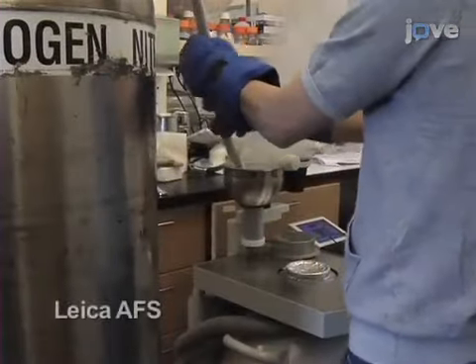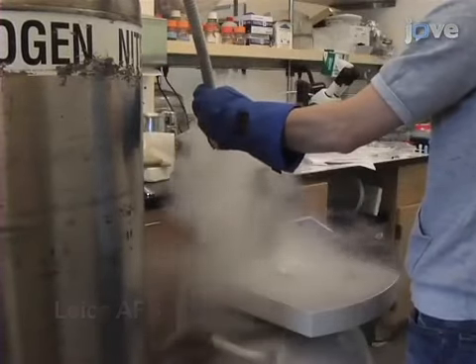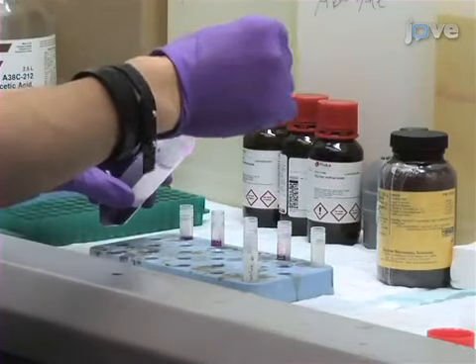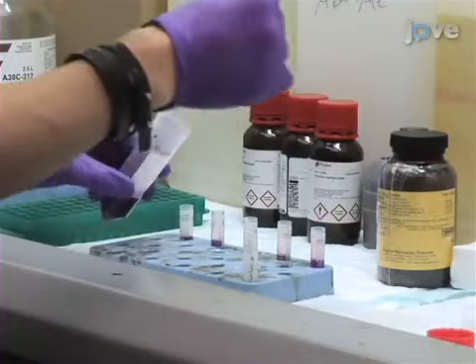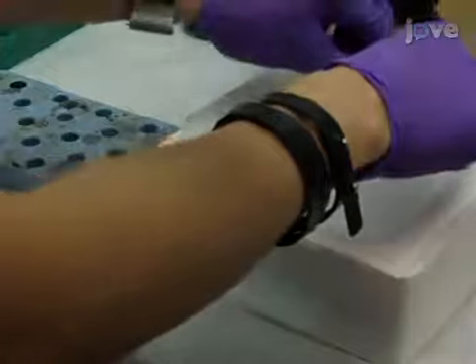The following procedure will be demonstrated using transgenic nematodes that express histones tagged with the fluorescent protein TDEOS. For this demonstration, we will use bacteria as a cryoprotectant, but you can also use 20% BSA for freezing C. elegans. 1 hour before freeze substitution, fill the automated freeze substitution, or AFS, device with liquid nitrogen. Also in advance, prepare the needed fixatives according to the instructions in the accompanying document. Store the fixatives in 1 ml aliquots in cryovials and place them in liquid nitrogen until they are used.